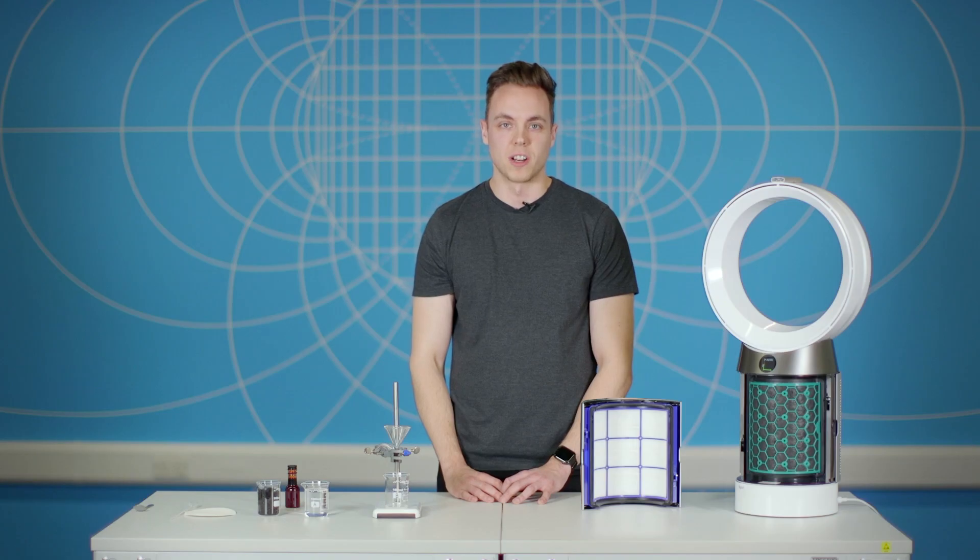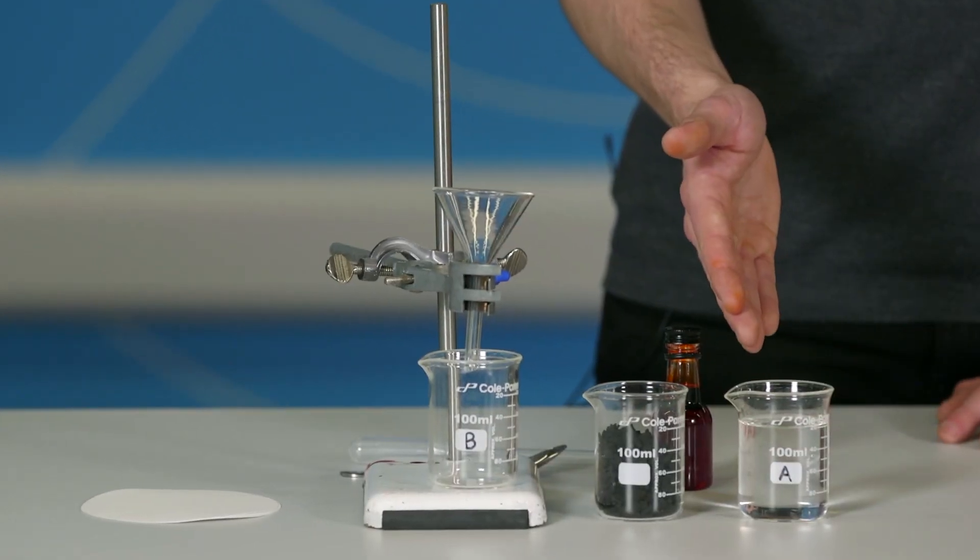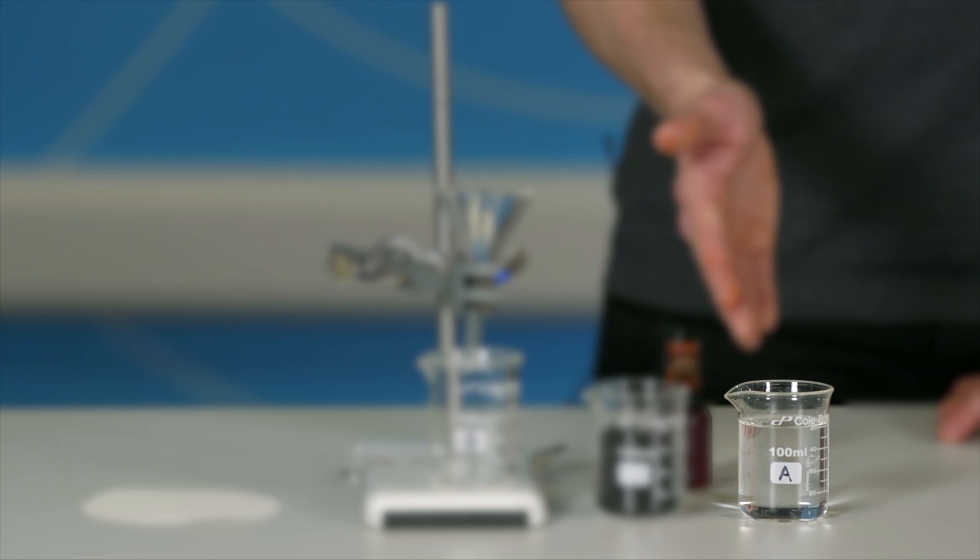I'm going to complete a simple experiment to show you how activated carbon works. So let's start with a beaker which we're going to fill to around 100 milliliters of water. The water here represents the air you're breathing right now.